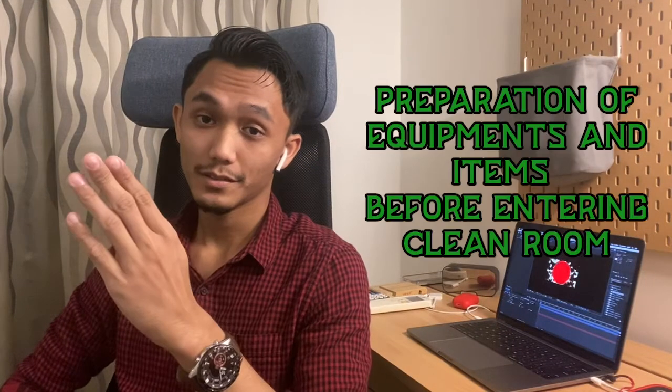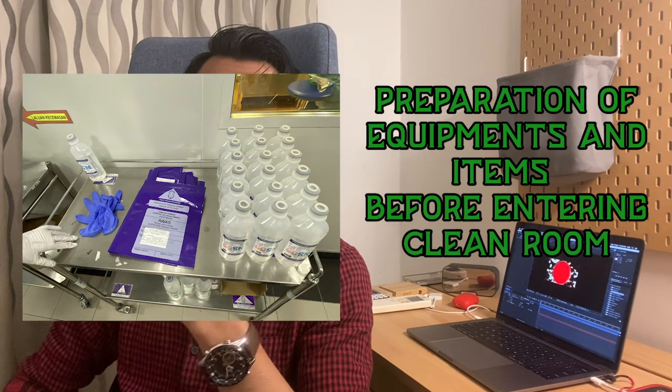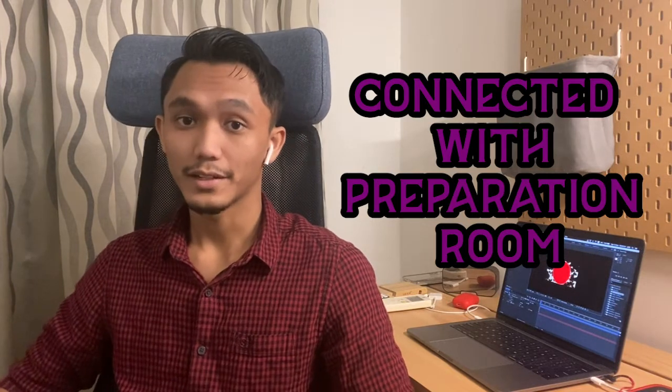Our workflow is, before we enter the clean room, we will do some preparations on medications and equipments. And when we're done with the preparation, we will put them into the pass box. That pass box are connected with the preparation room inside the clean room. Now, let's enter the clean room.